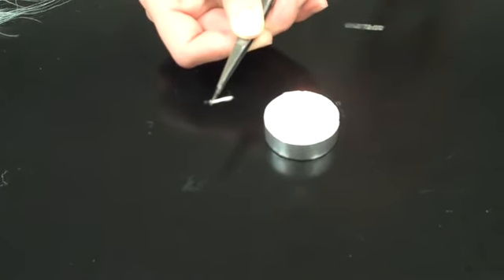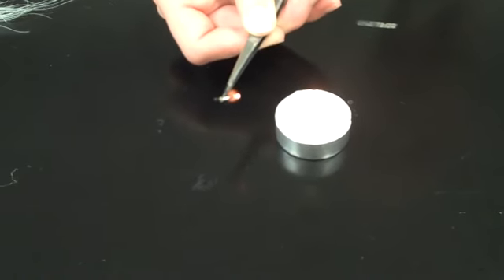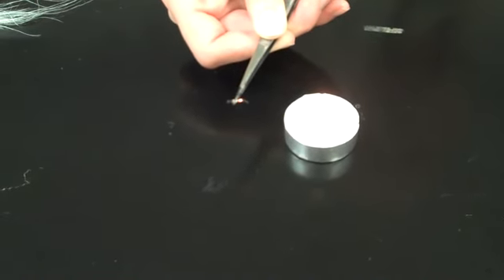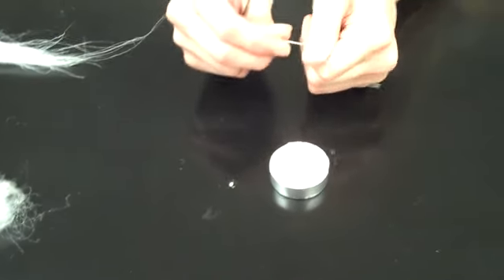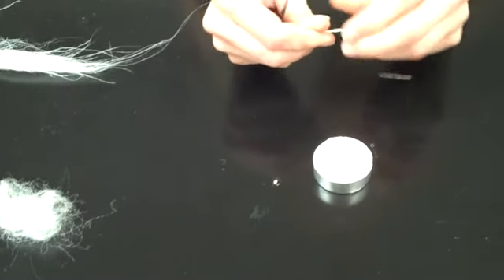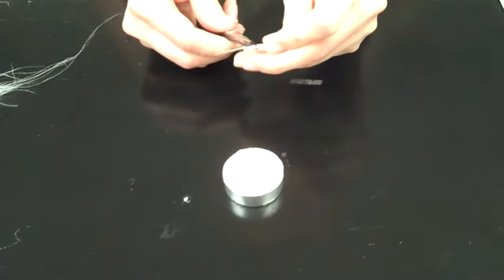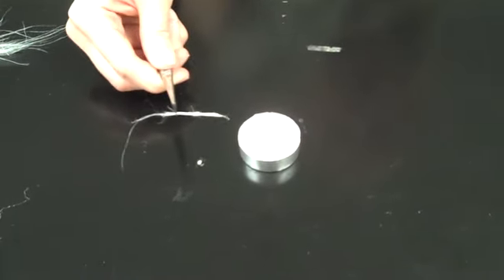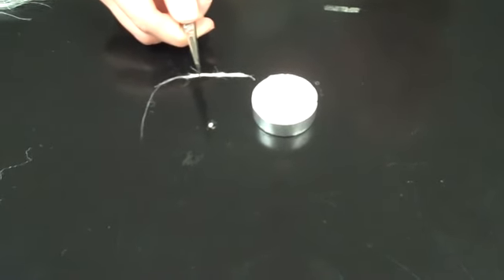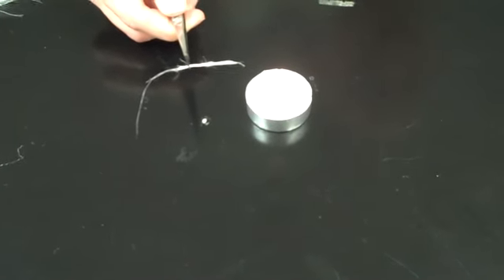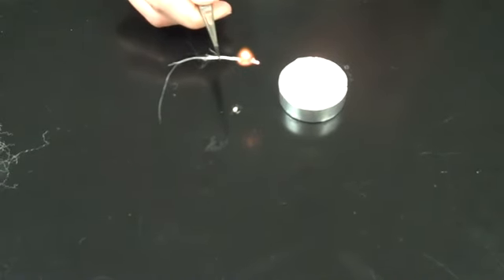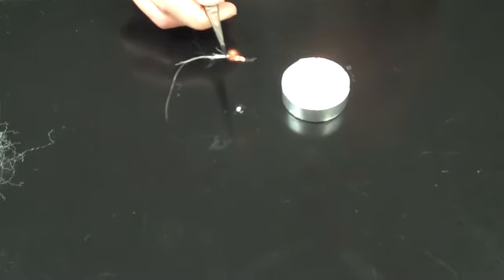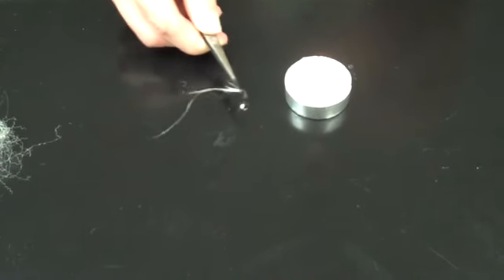So that one self-extinguished. No, I just didn't have enough going. Let me do a little bit more of that one just so you can see a few more of the characteristics. Again, I'm going to twist another nice little bundle of fibers. Let's try one more time just to make sure you got the right results on whether it self-extinguishes or not. There we go. It's definitely still burning, so it does not self-extinguish.